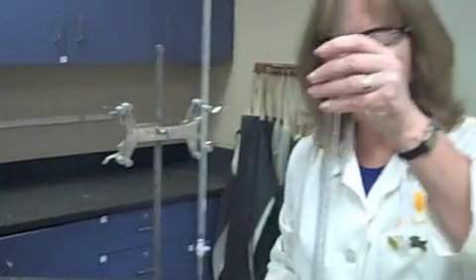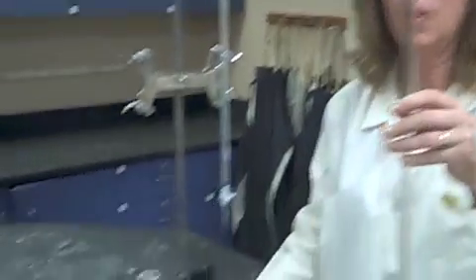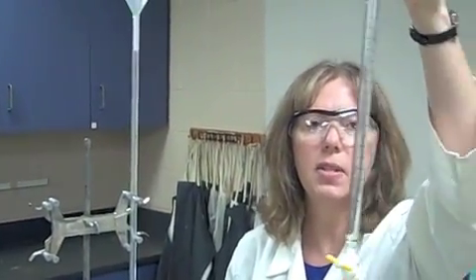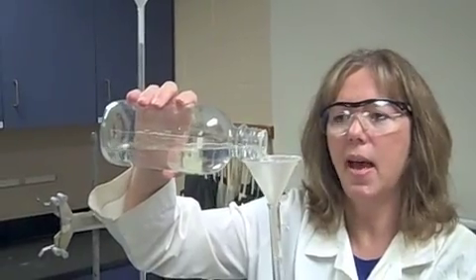So once that is cleaned, I'm going to add the amount of acid that you need. So here we go. I'm adding the acid. And again, the biggest mistake is students leave that stopcock open. So I've got it perpendicular, and I'm going to add the acid.